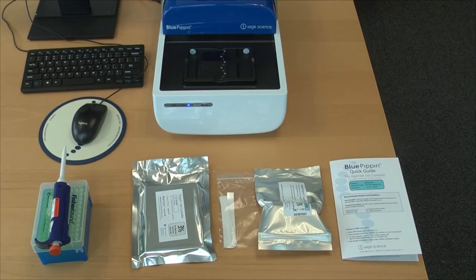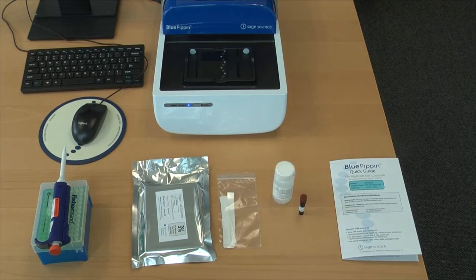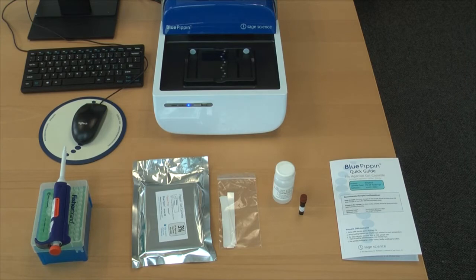Users will need to supply a P200 pipette and tips, a cassette, elution well sealing tapes, reagents warmed to room temperature, and the quick guide should be made available.